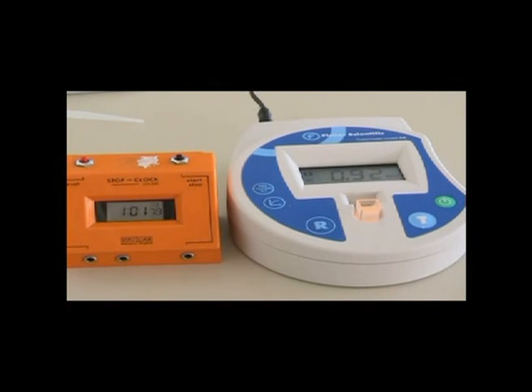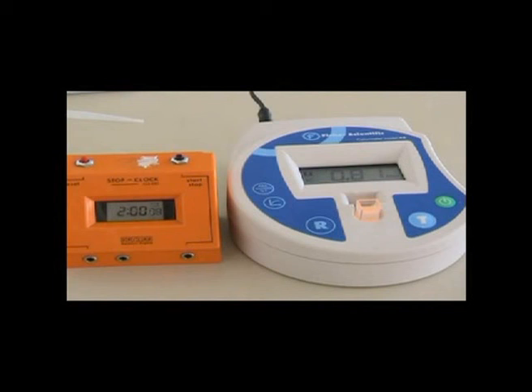Coming up soon in the film, at the end of this last sequence, will be the 5 graphs promised. The equation for the line is given in the top right hand corner of each graph, and the figure in front of the x in the equation for a straight line, y equals mx plus c, the figure m in other words, is the gradient of the line.